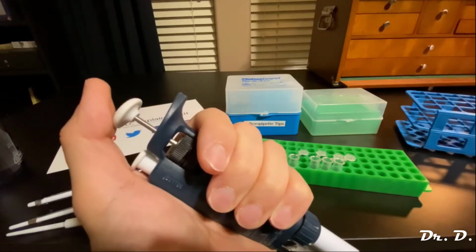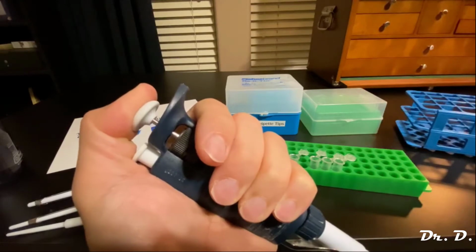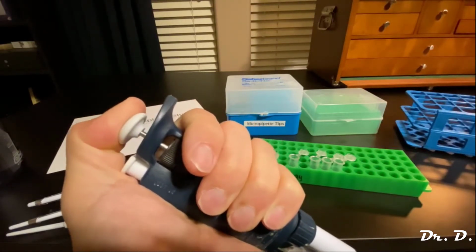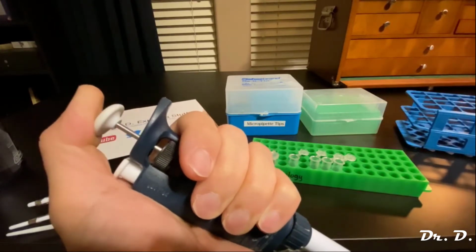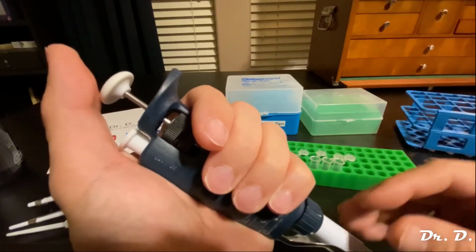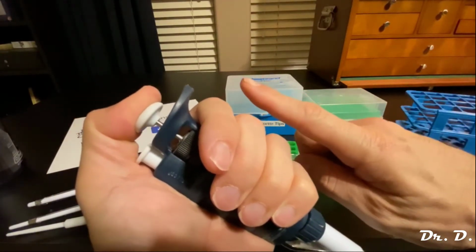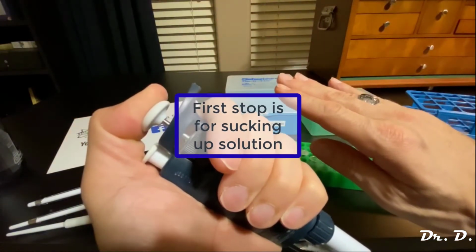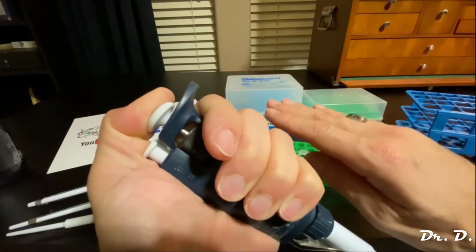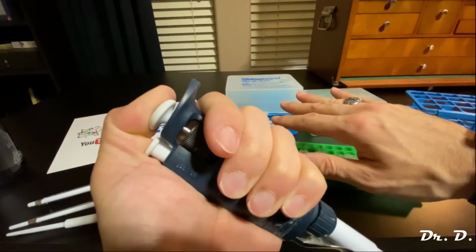So there are two stops, aren't there? You push till it stops. Now, if I really push hard, it keeps going. So there's a second stop. Why is that the case? Here's what you need to understand, and this is really, really important. When you're sucking up solutions, you push till the first stop, and that's it. You do not go to the second stop when you're sucking up solution. You go to the second stop when you're dispensing the solution.